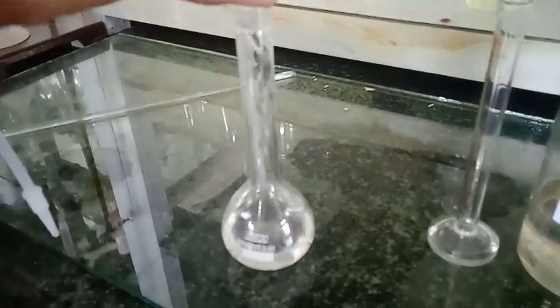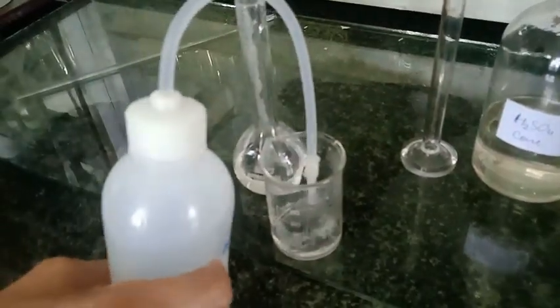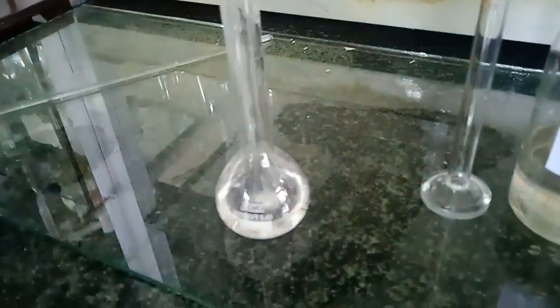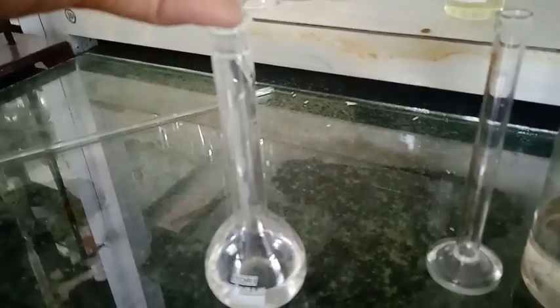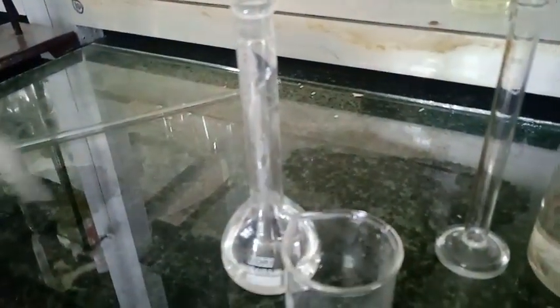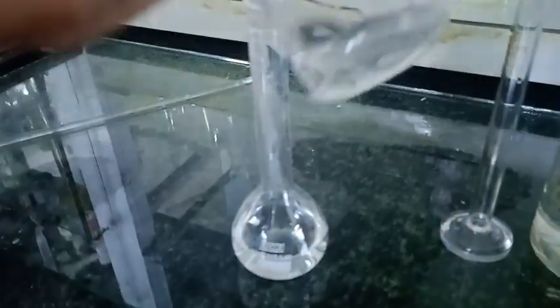I am again going to rinse this beaker. It is better to take a small amount of water to add the concentrated H2SO4 so that you have enough space to add into the measuring flask.